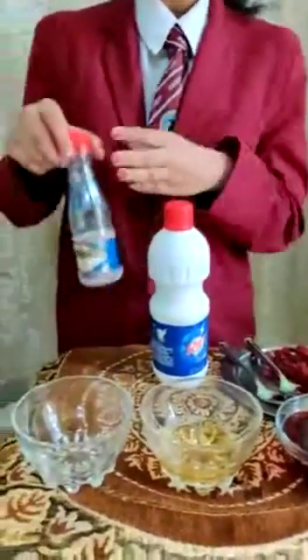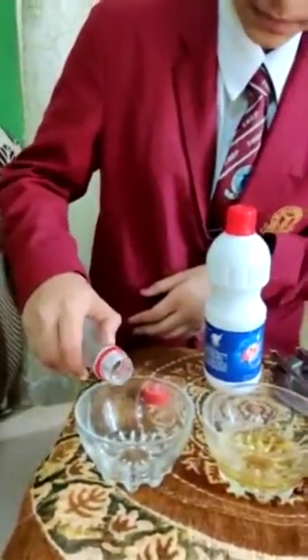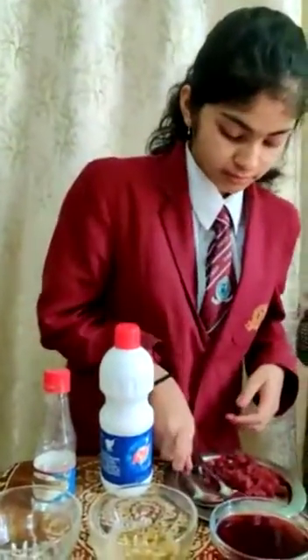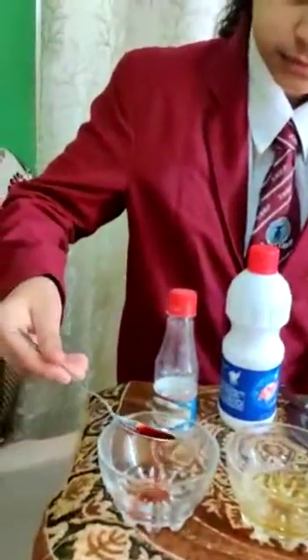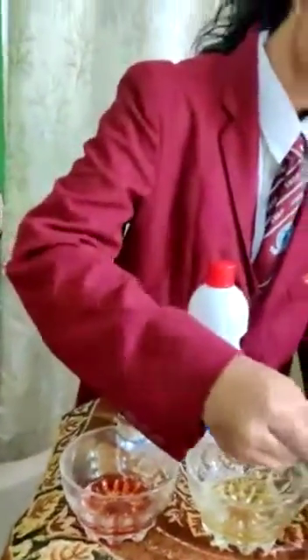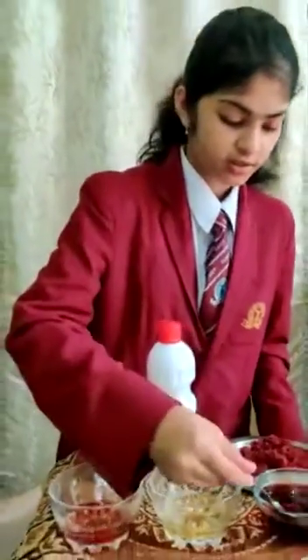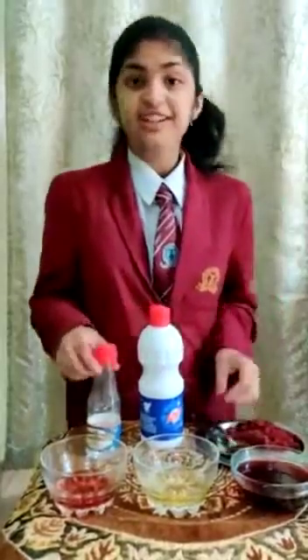Now let's check what is the nature of vinegar. As you can see, it is showing no change. This means that vinegar is acidic in nature.